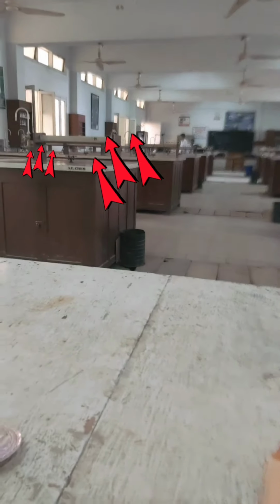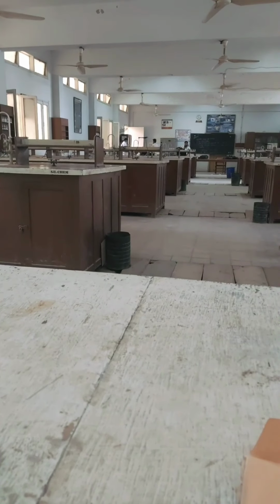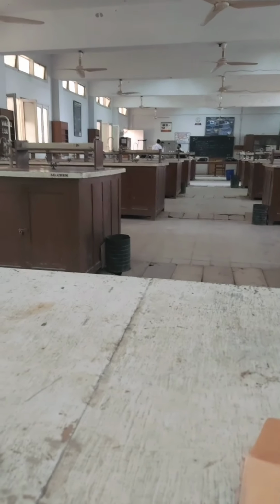So this is part 3, and those students at the back are the latecomers. They appeared late in my lab, so they were not allowed to do this experiment today. They are just standing there and waiting.